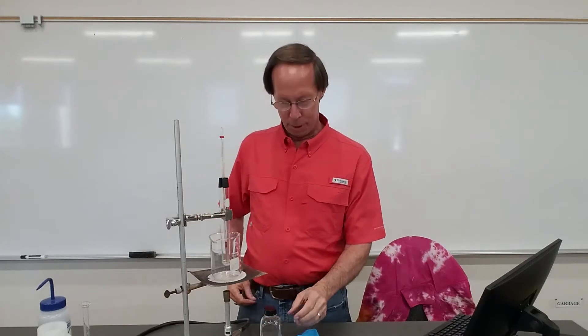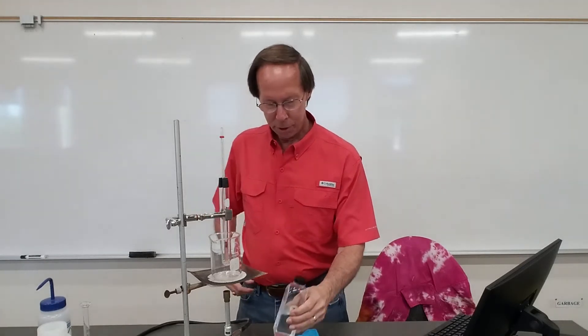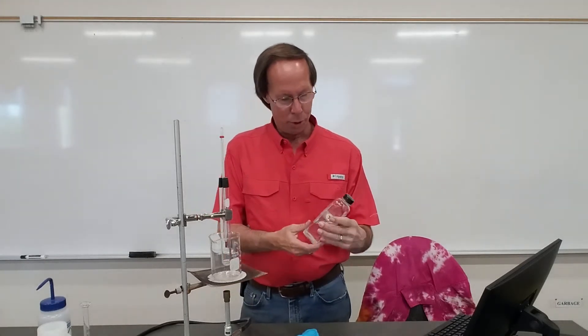Hi, everybody. Today we're going to be doing experiment number three, which is the identification of an unknown compound — in particular, an unknown liquid.